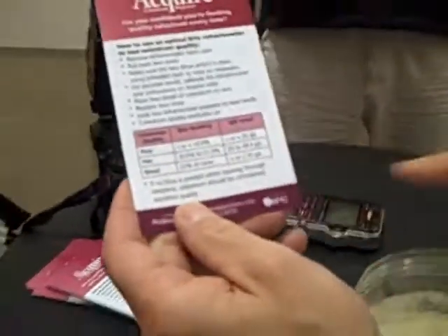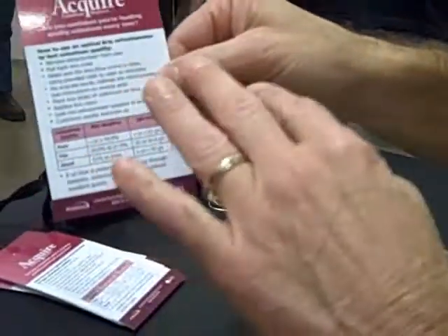This sample is about 15 percent, so this would qualify as poor quality colostrum. What makes it poor quality is that the IgG concentration is quite low.